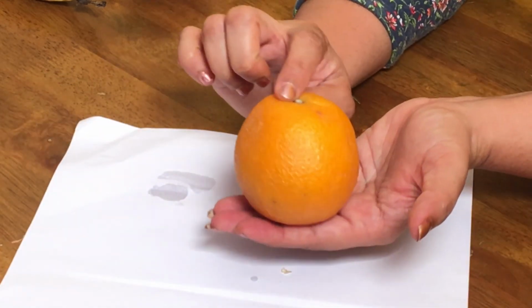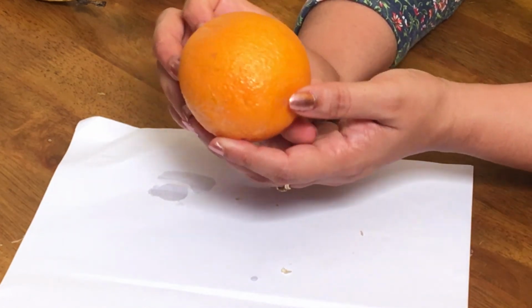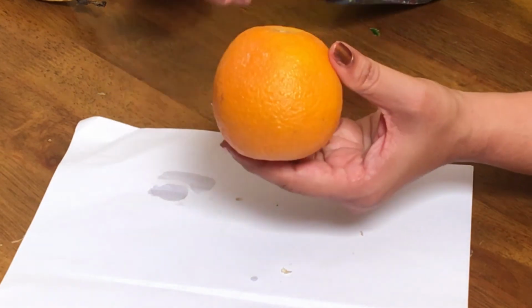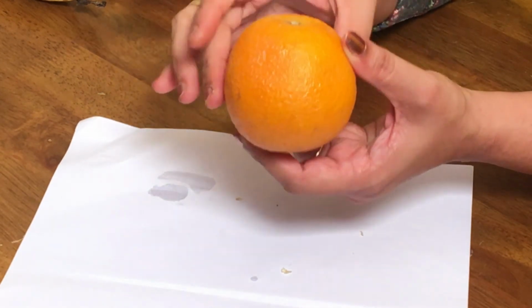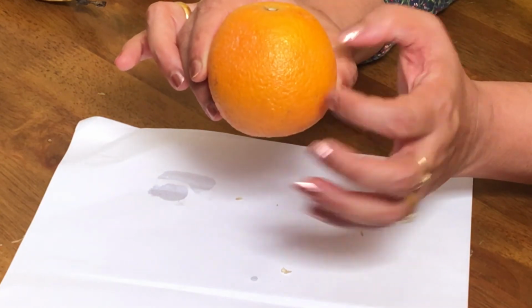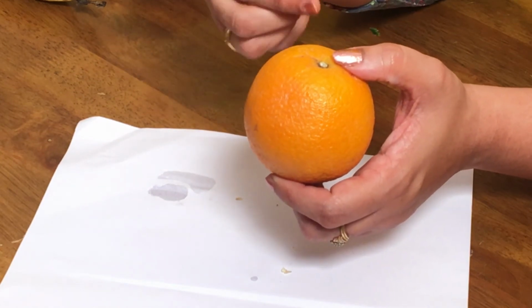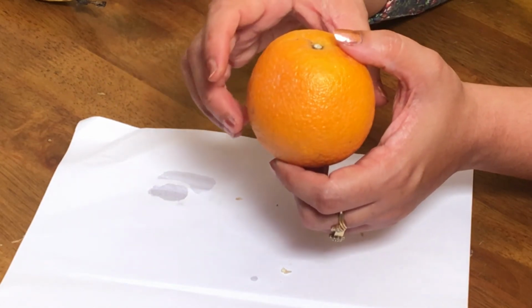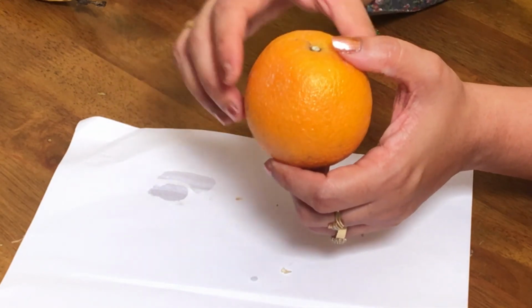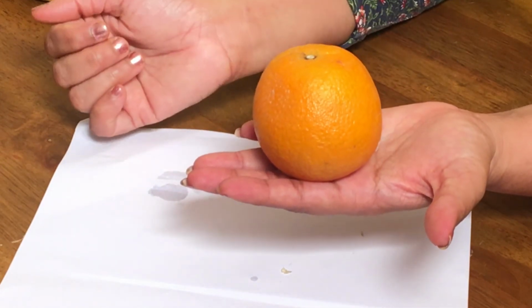Orange, again a simple fruit, and this type of fruit is called a hesperidium because it has a leathery skin which has a lot of oil glands. And this orange part is the epicarp. The white part, which is generally bitter, is the mesocarp, and the endocarp forms very thin hair-like structures which are very juicy and edible, and they are the placental hairs together with the endocarp. That is the edible part which we eat in the case of oranges.